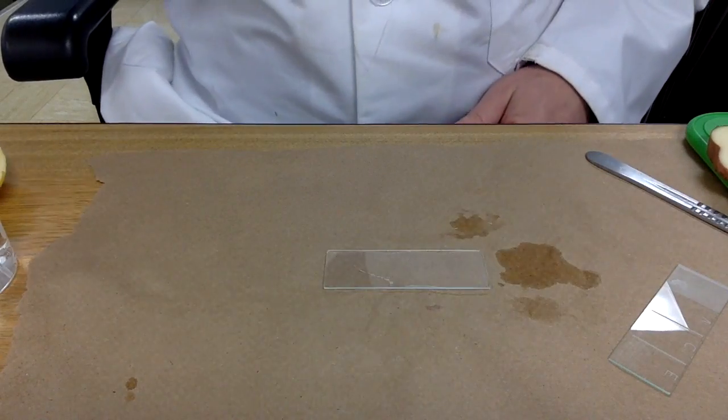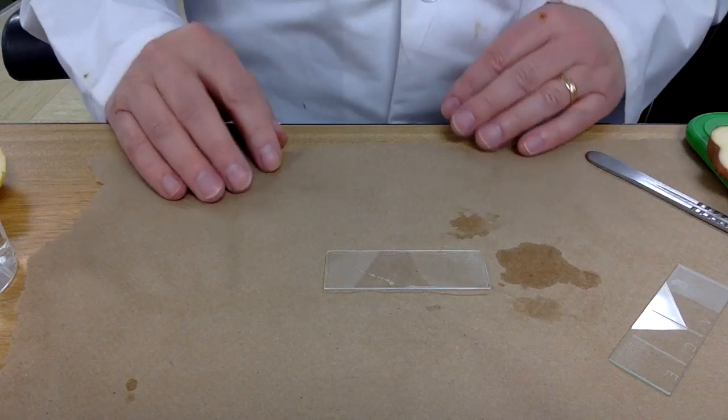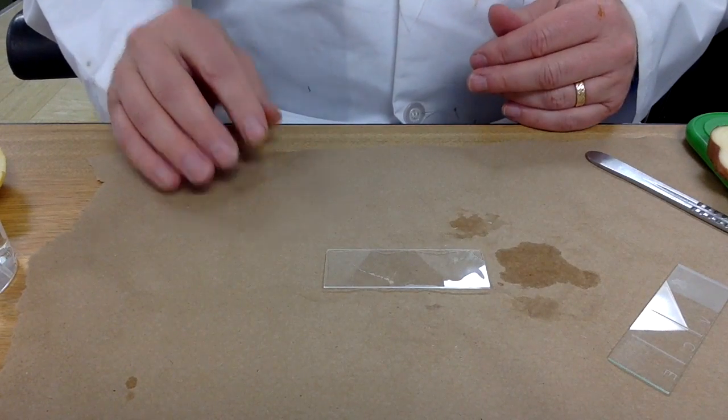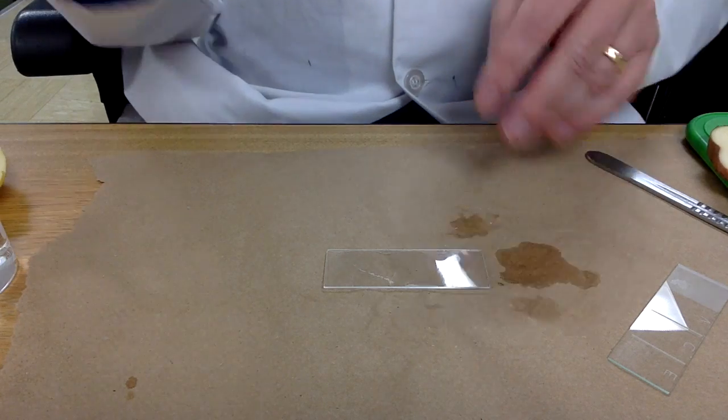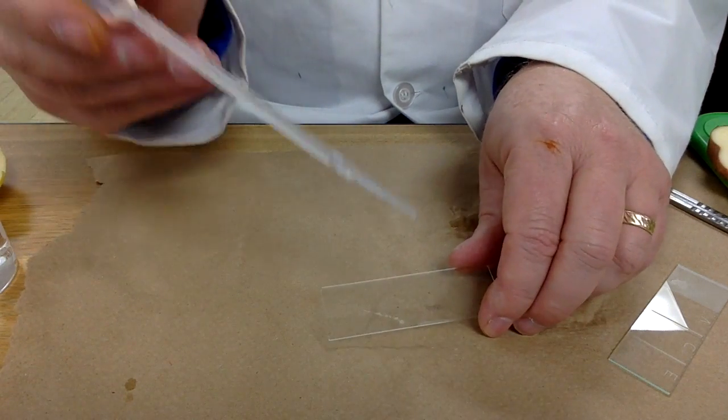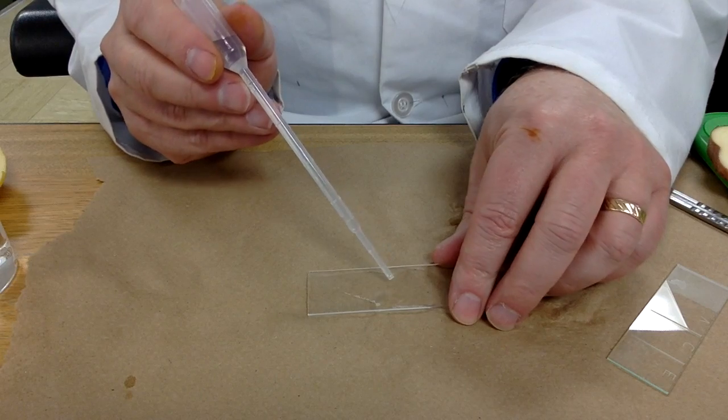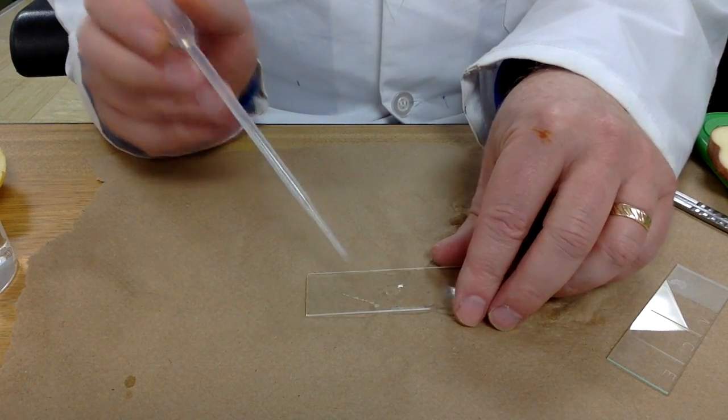We will be preparing slides in what we call a wet mount, and the wetness is coming from water. So take my slide, take my pipette with some distilled water, and we'll put a drop on that slide.